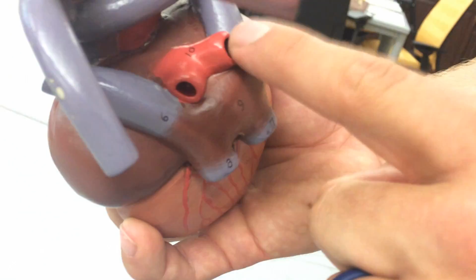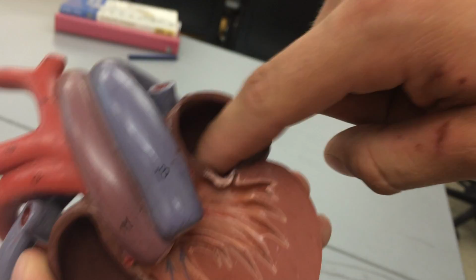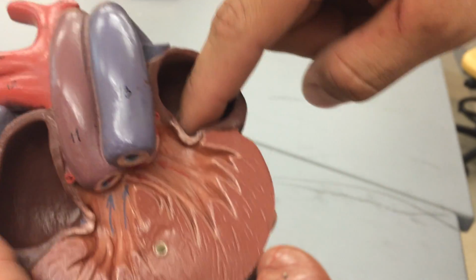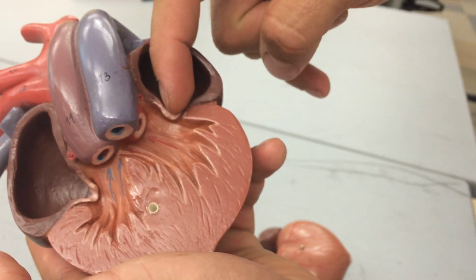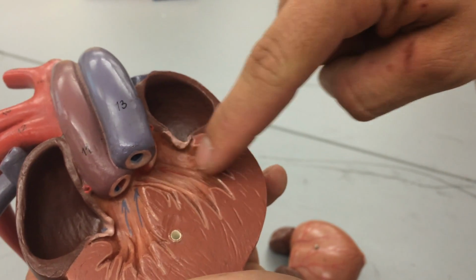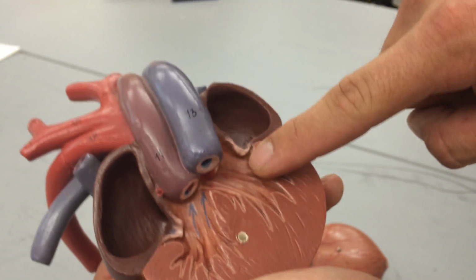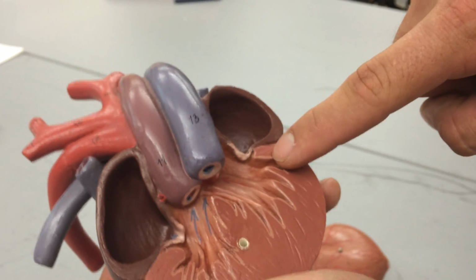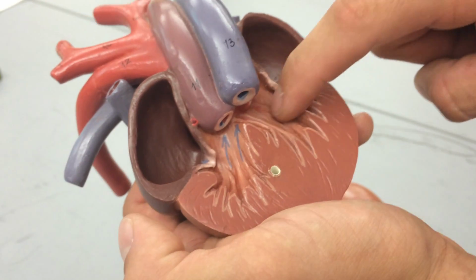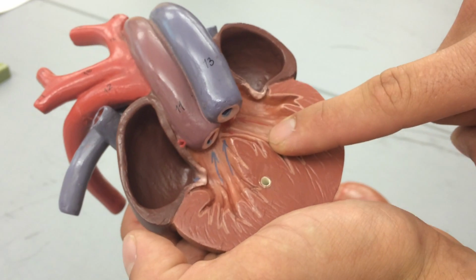You can say this would be the left and the right pulmonary veins, which are going to feed into our left atrium. There's a left atrium here. It's going to flow through this valve called the mitral valve. Okay. Now this part doesn't depict it super well, but in this little corner here, you're going to have one little division that's going to be called the cavum arteriosum.